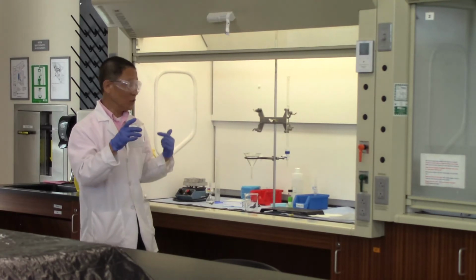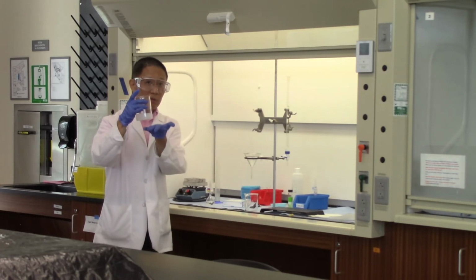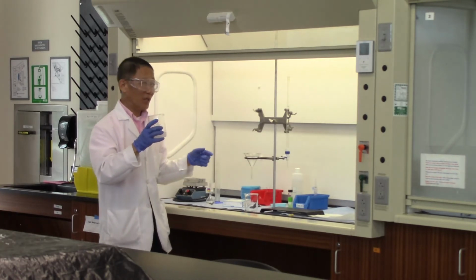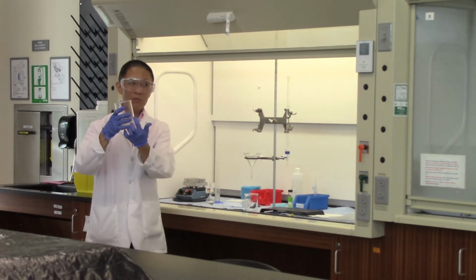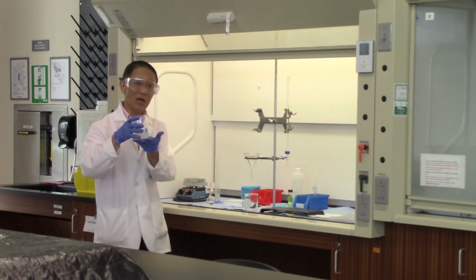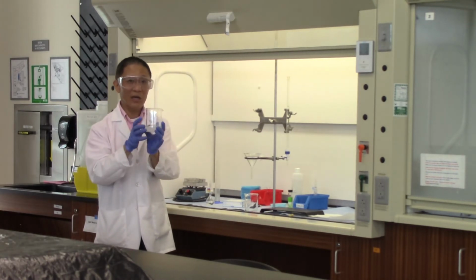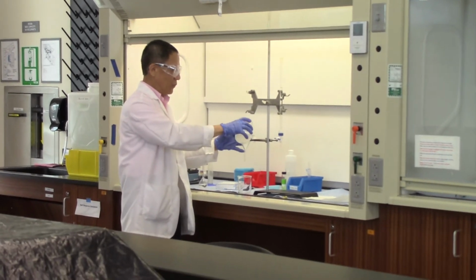One trick for doing a quick filtration is that when the solution is all settled, all the solids are on the bottom, so you don't want to stir them up. You want to pour the clear liquid into the funnel first. Then, when the majority of what's left is the solid, that's when you stir it up. For this quick demo, the solution hasn't completely settled yet, so we're just going to pour the solution into the funnel.